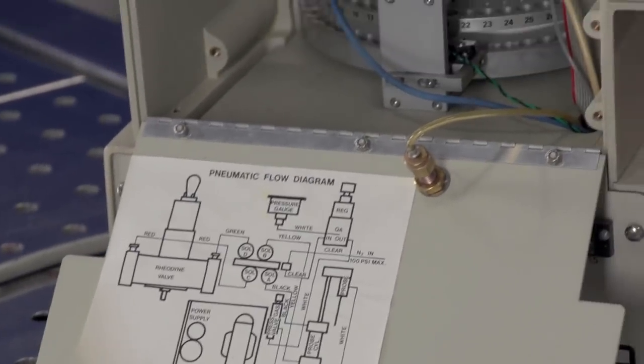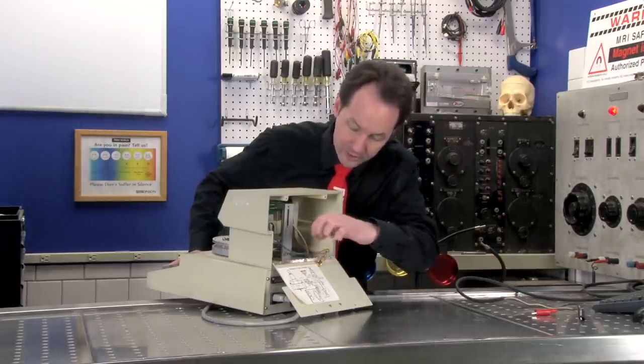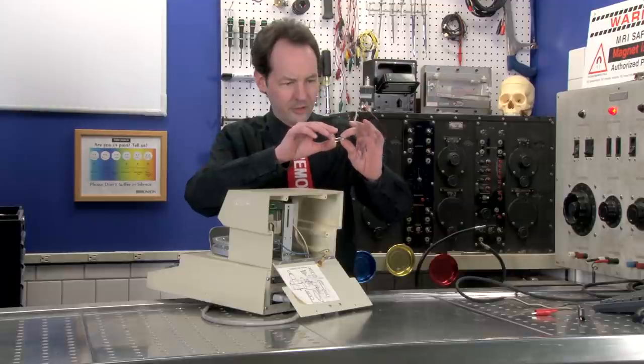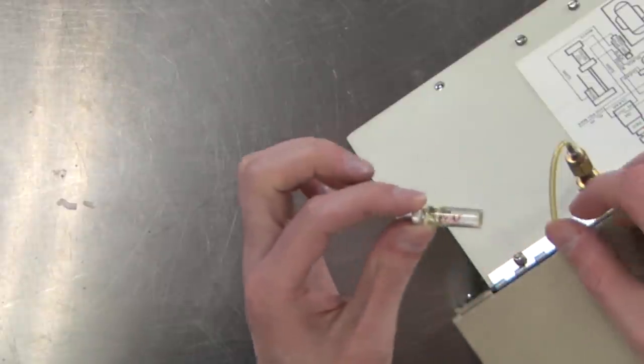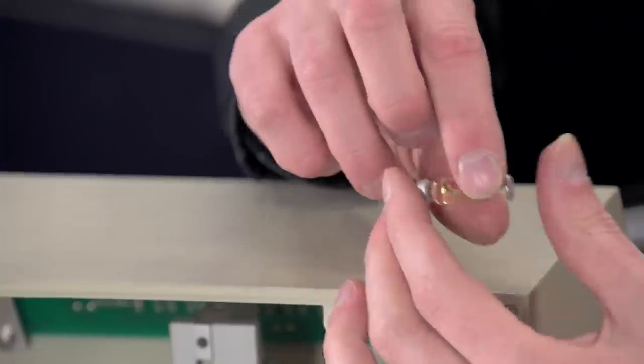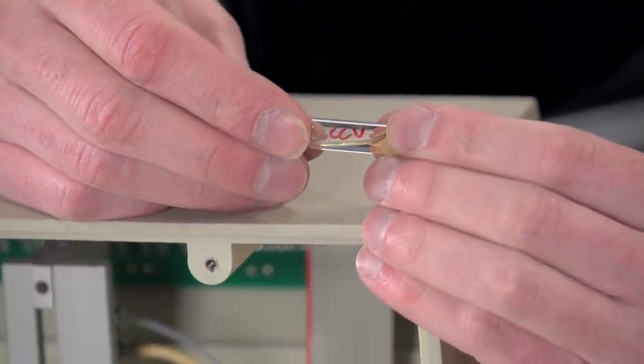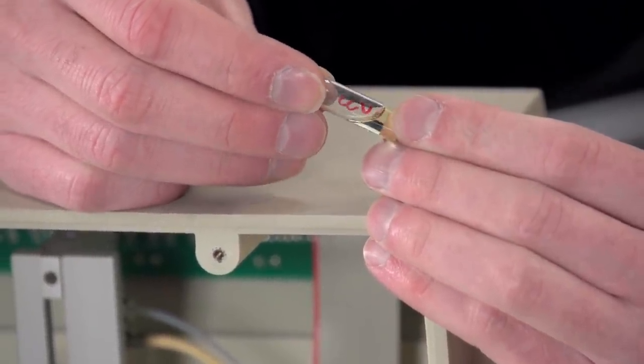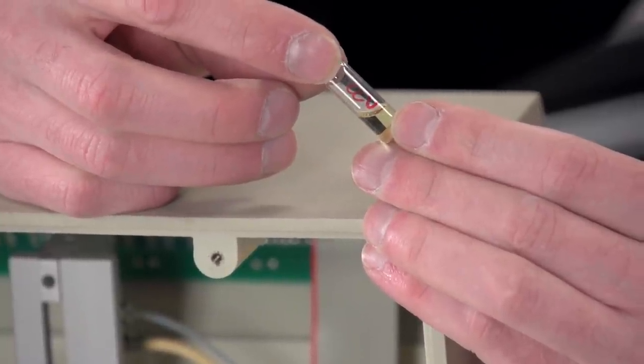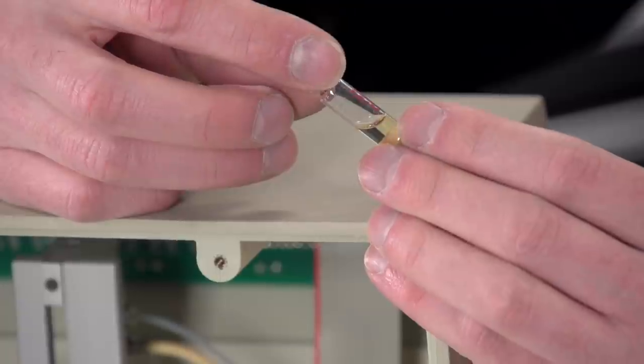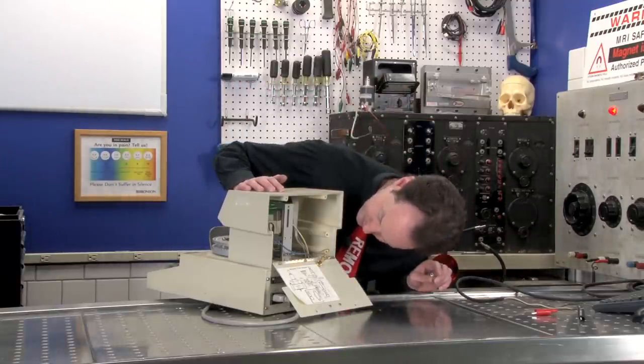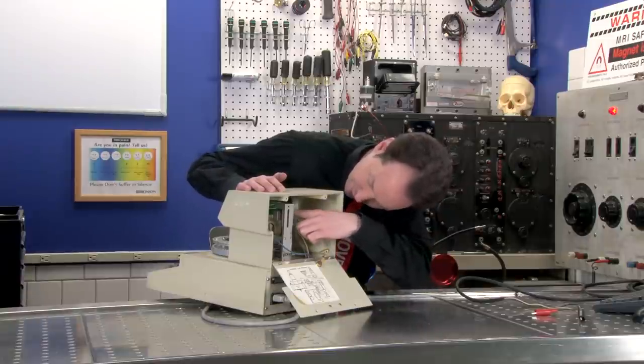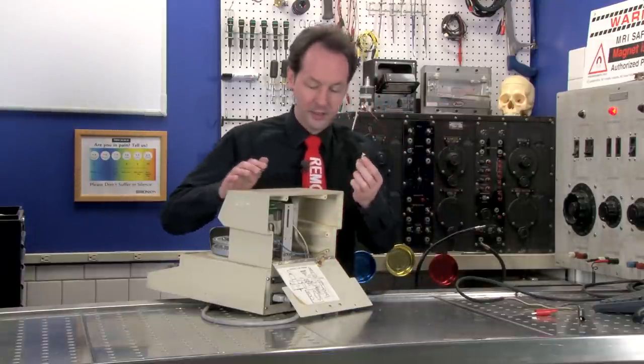This is kind of obnoxious to get into. Oh, there's a vial. It's labeled WV or CCV. I don't know, but that's our vial. Here, I'll turn it here and you can get a shot of it. I don't know what's in it. It is a pale yellow liquid.